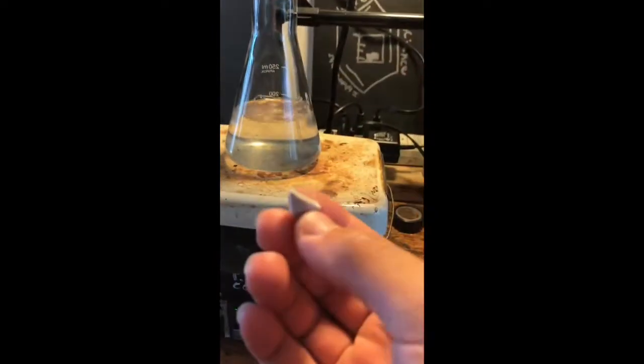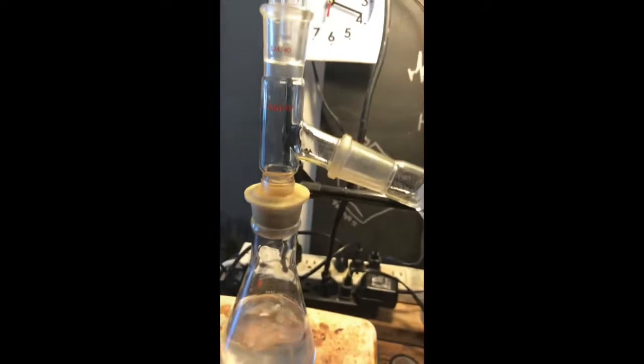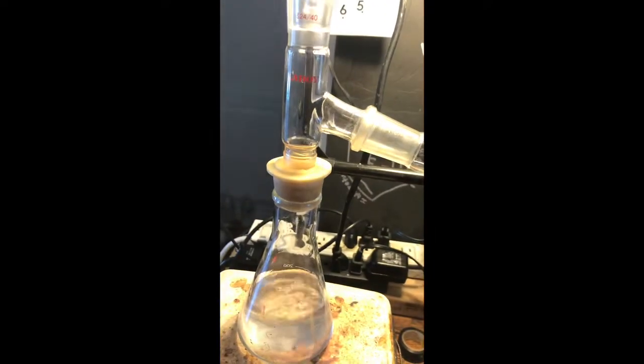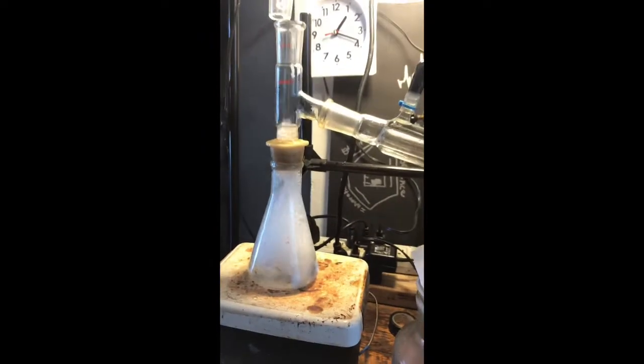You can see the acetone's not boiling well, and that's because I didn't add a boiling chip. As you can see I'm putting one in right now — and yeah, you could probably guess what's about to happen. There goes — acetone just went everywhere.